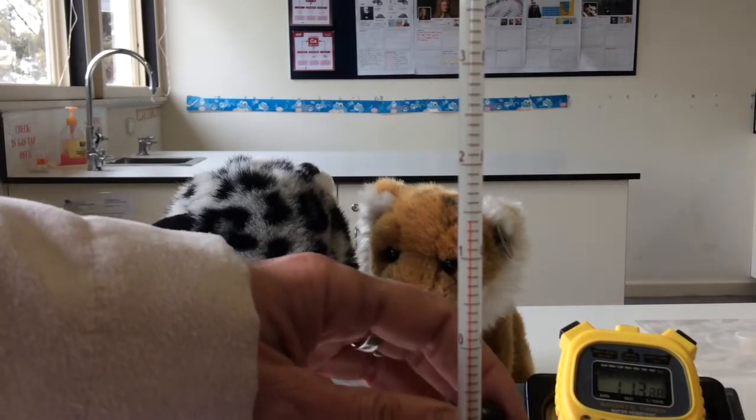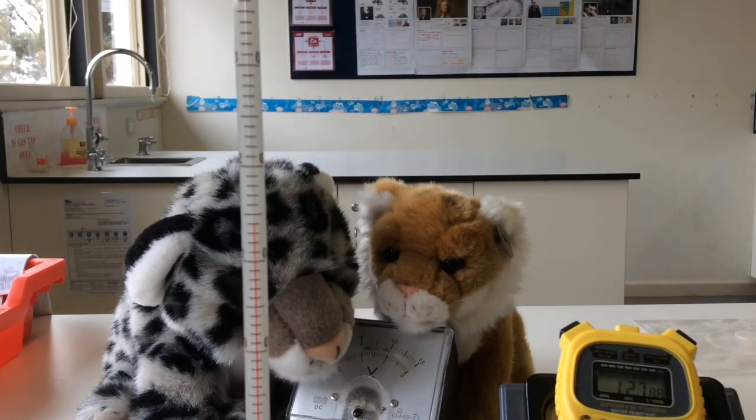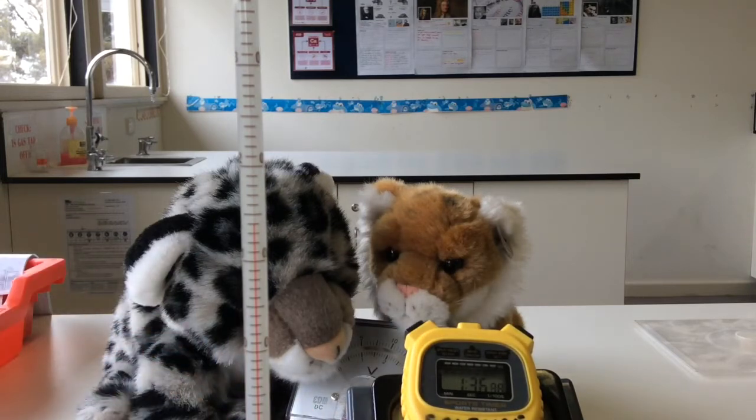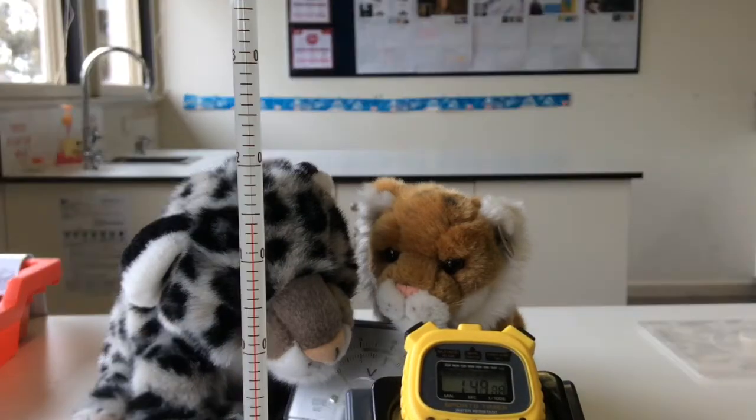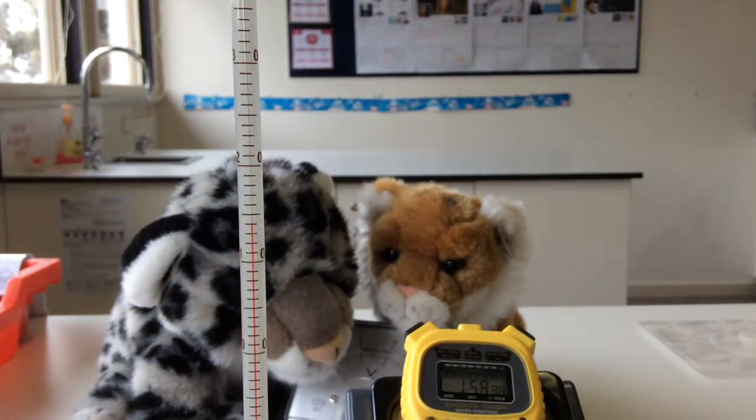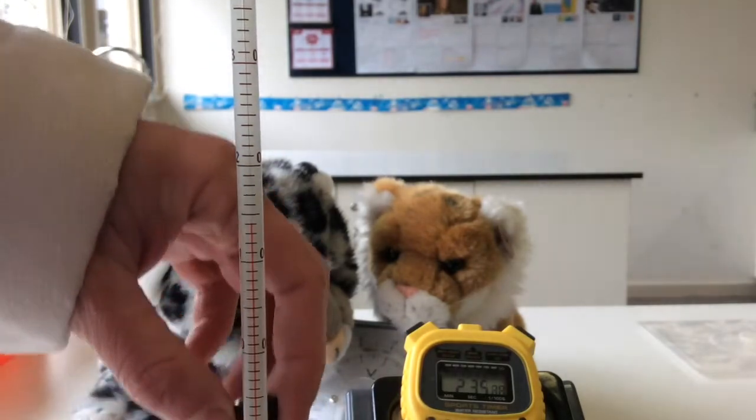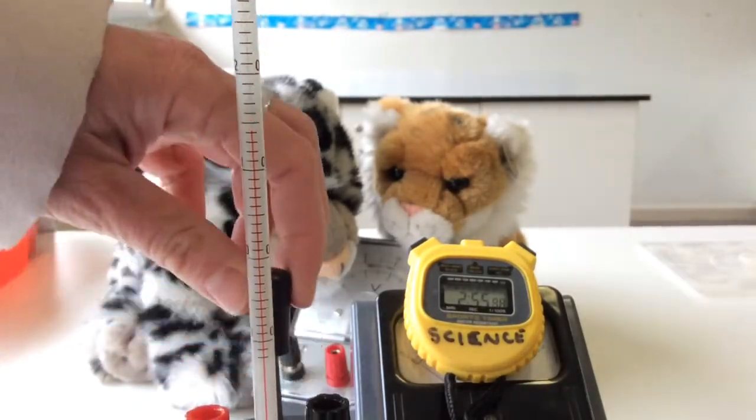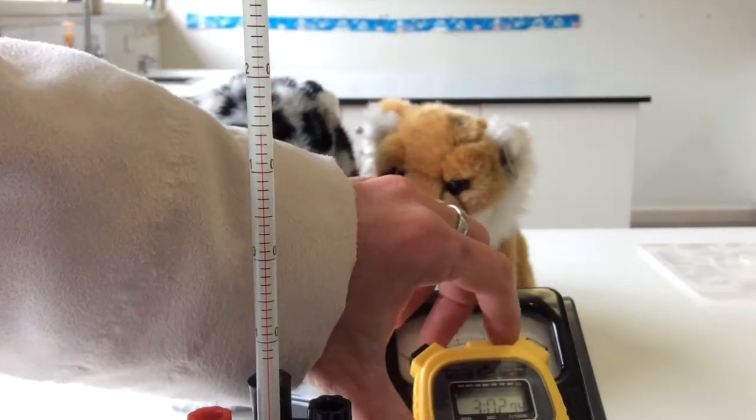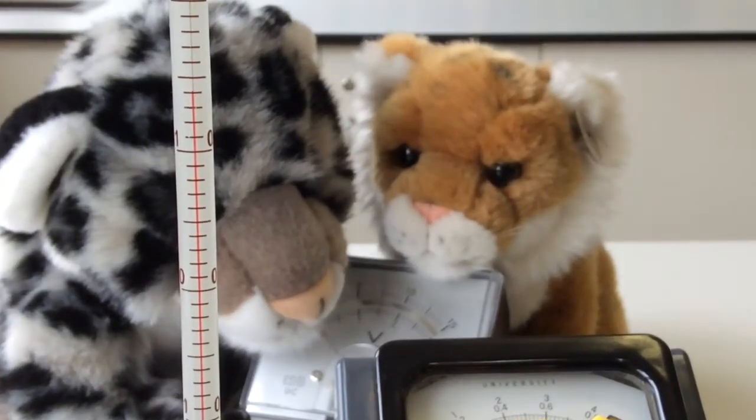It's not really changing its temperature. All right. Okay, that's three minutes. I'm going to stop it there. Temperature hasn't changed. Make sure you read the temperature. Okay, that's going to be what we start at.